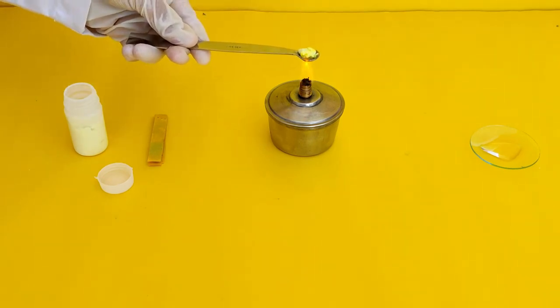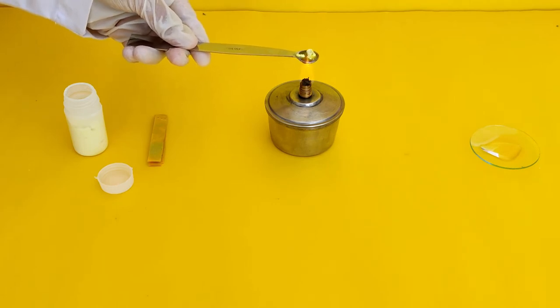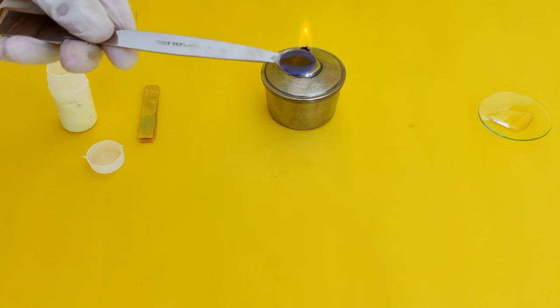You will see the sulfur starts turning liquid and when you expose it to the flame, it will burn with a blue flame.